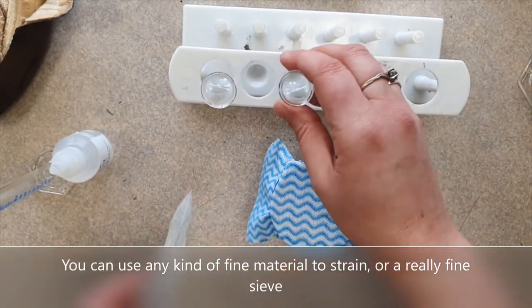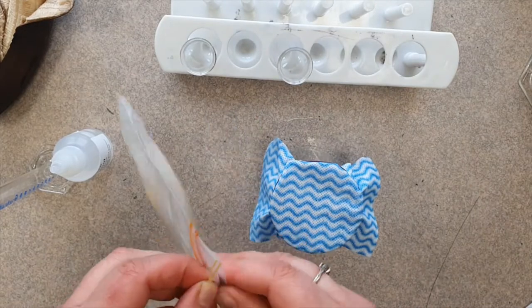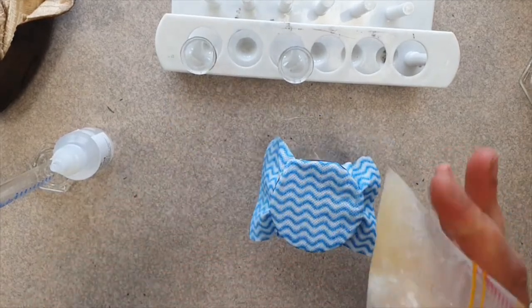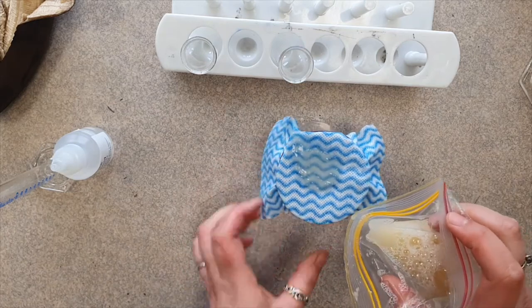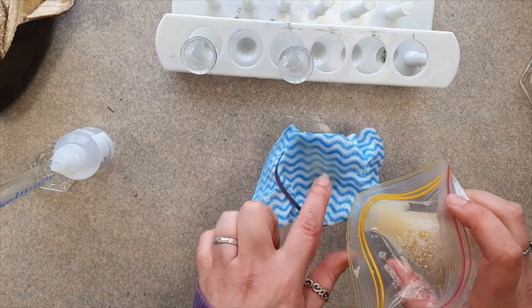So just get some chux and put it over a cup and that's how you can strain. I gotta do it slower. Make a little bit of a dent.